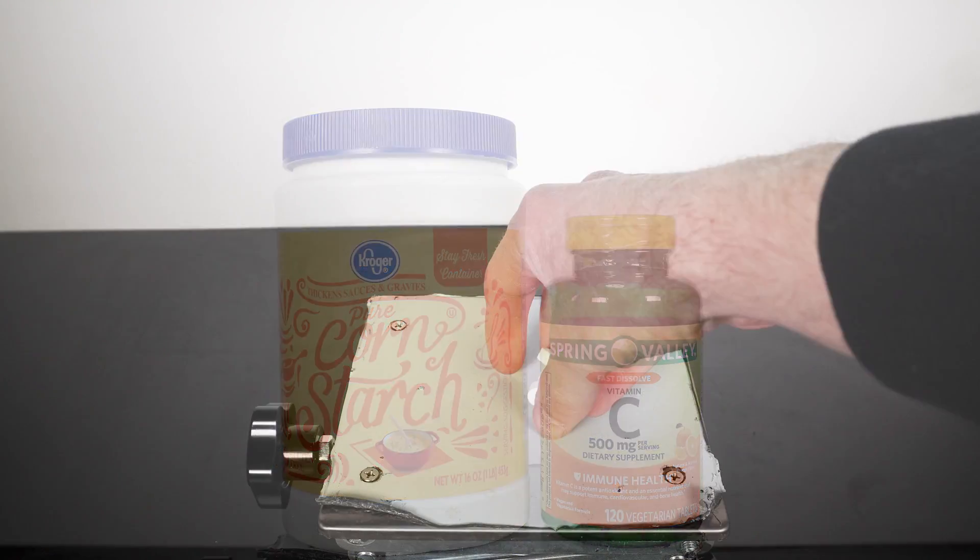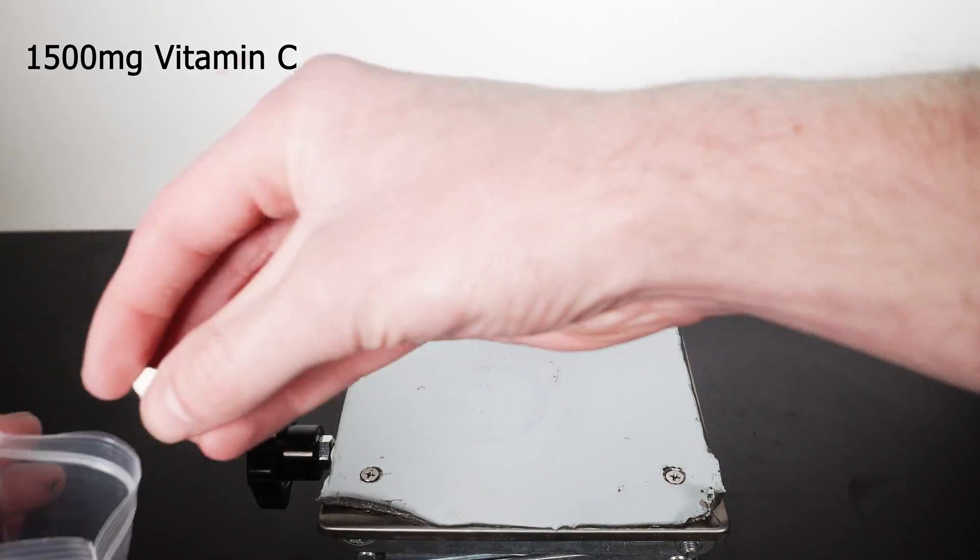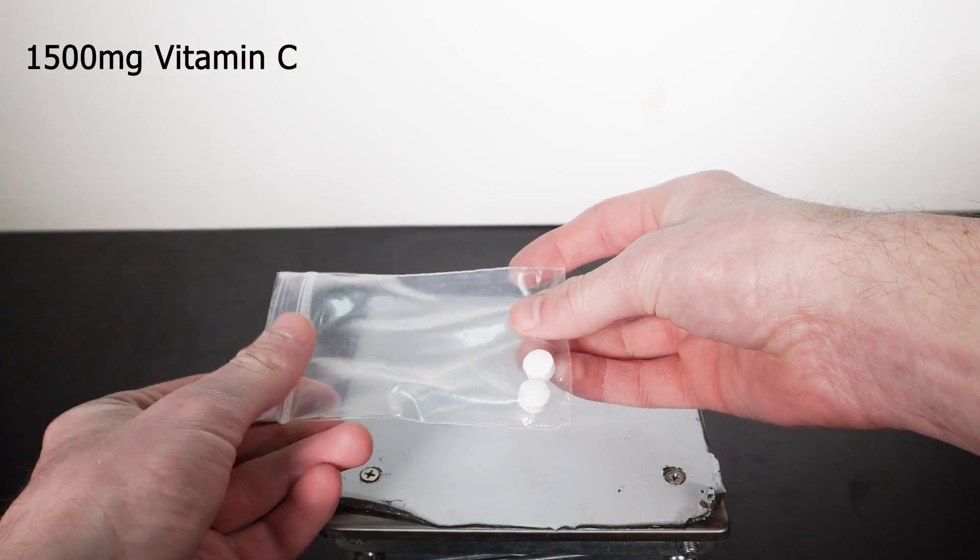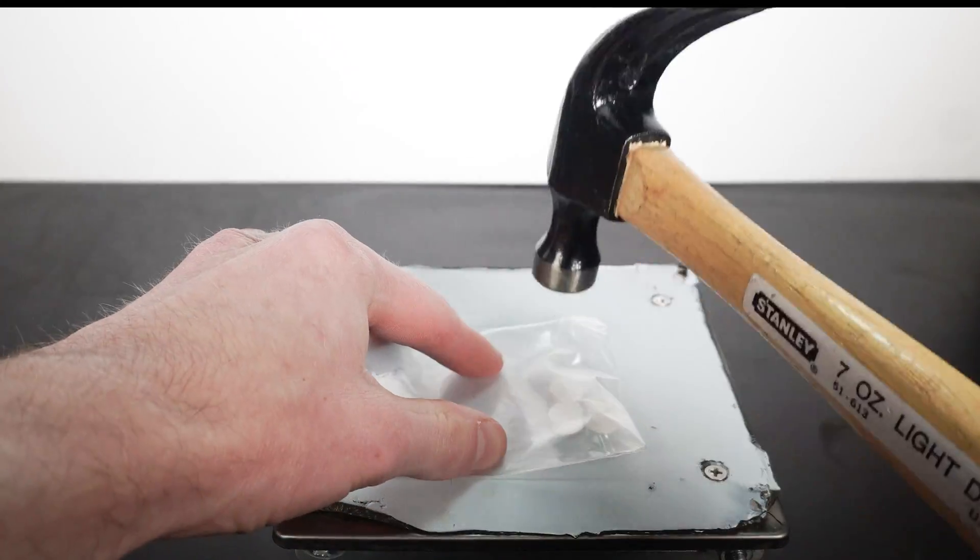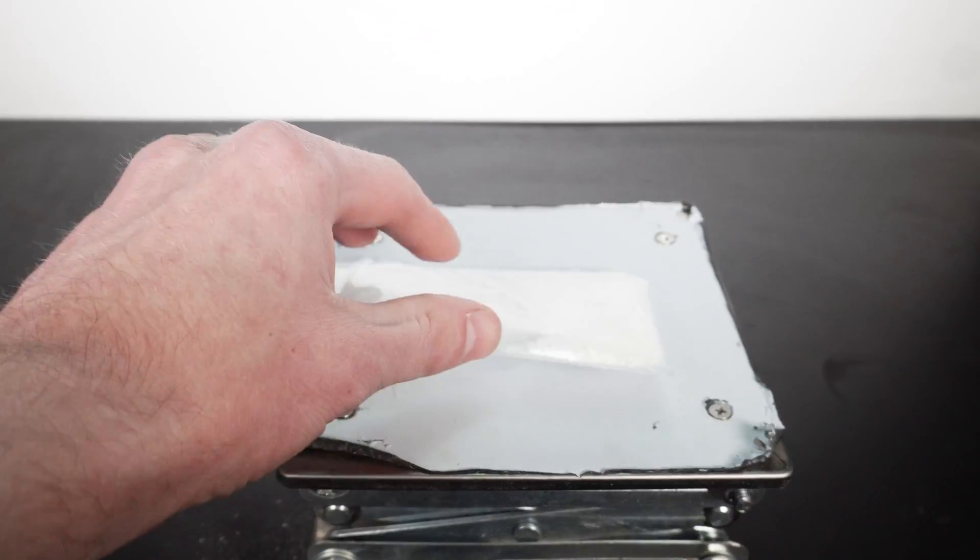The first thing I am going to do is take about 1500mg of vitamin C. We need to get into smaller chunk and powder sized pieces, and so I will add all 3 pills into a bag and smash them lightly with a hammer. It doesn't all really need to be powderized, though it will make the next step a little quicker.